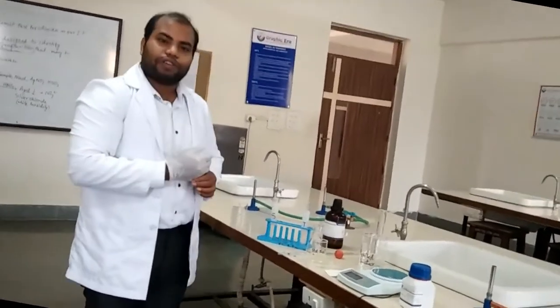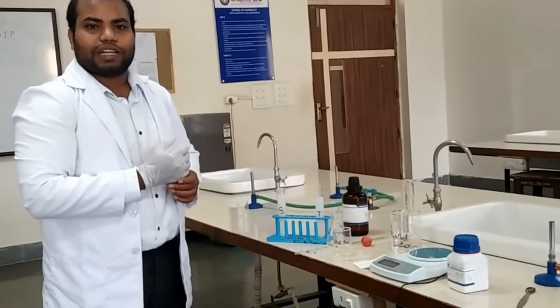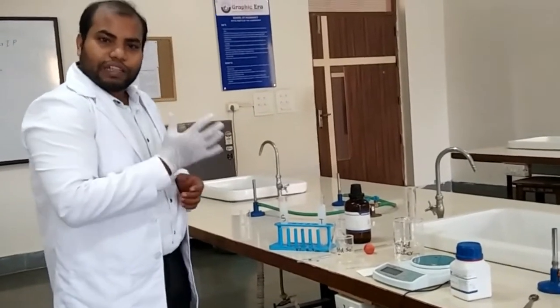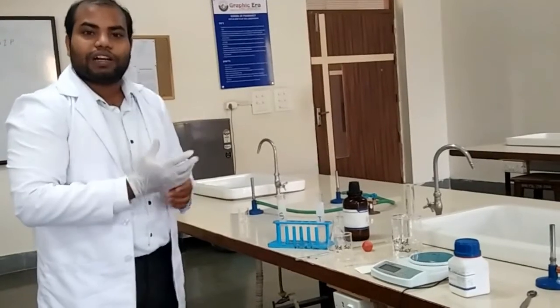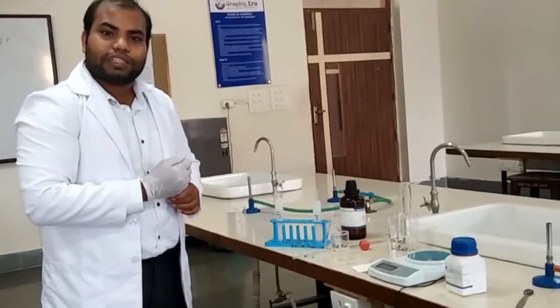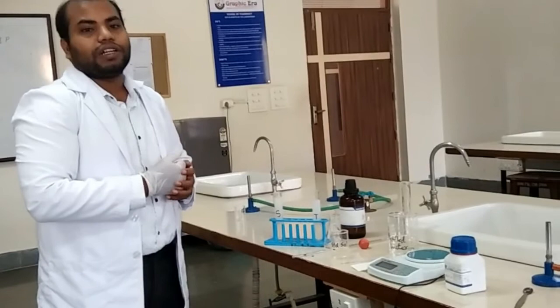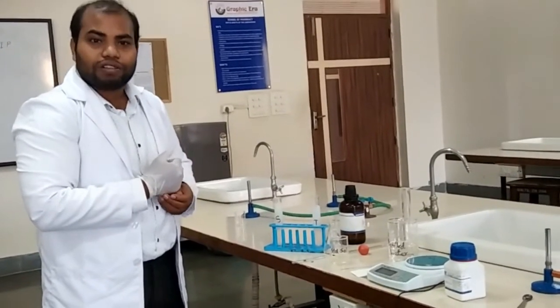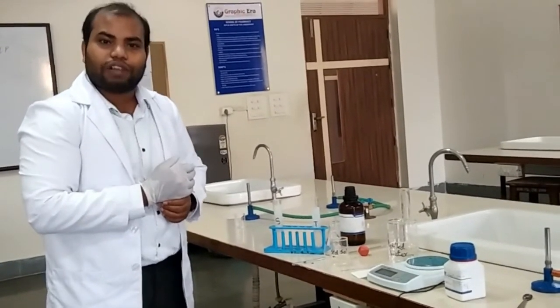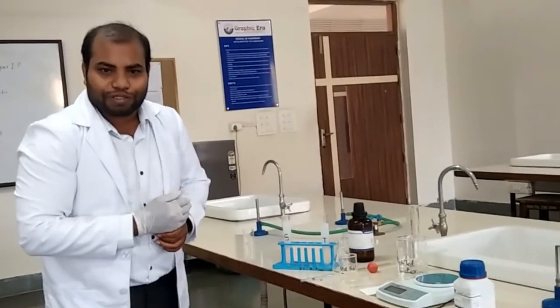Thank you for your time. Today in the laboratory we learned how to perform a limit test to control the impurities of ions that may be present in a pharmaceutical compound before further processing.